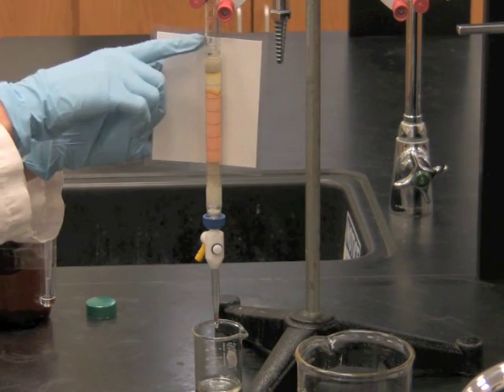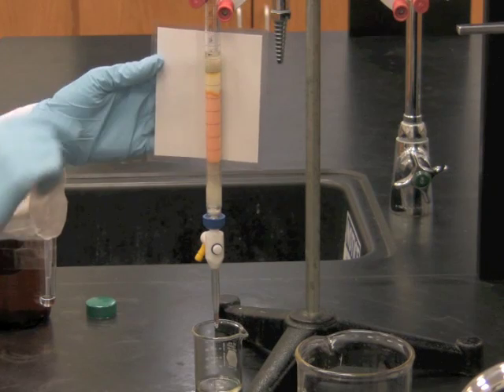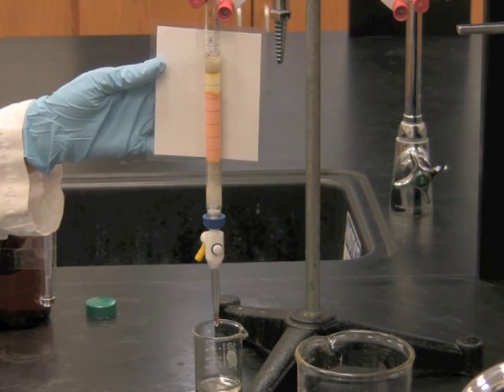Let the solvent reach all the way to the sand before you add more, but remember not to let the top of the sand get dry.